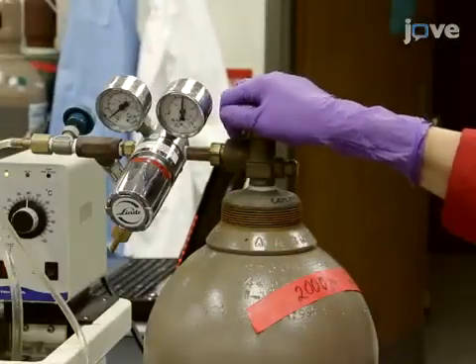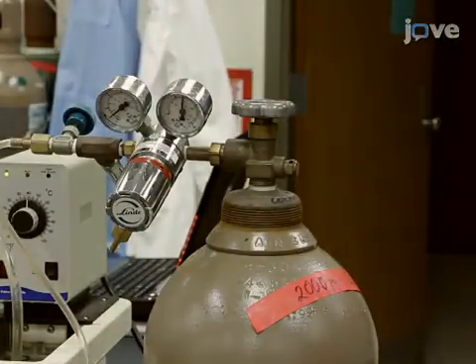Next, when connecting the gas, check for leaks then pressurize the system.